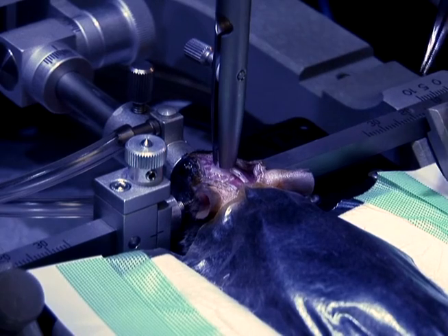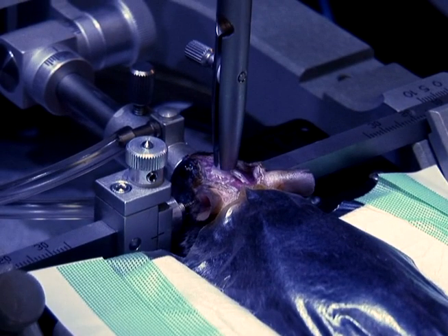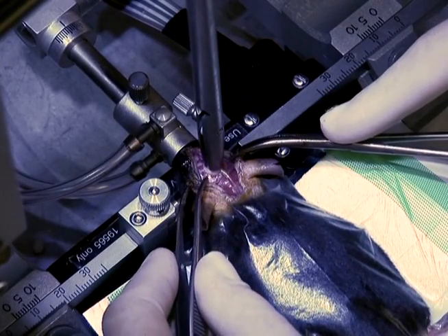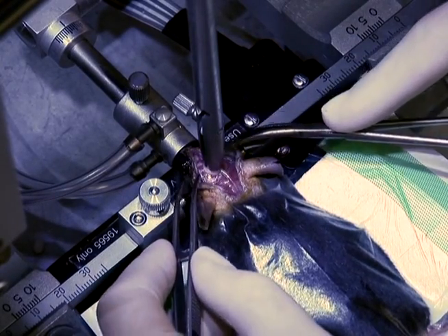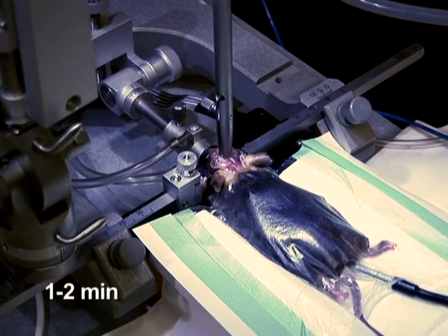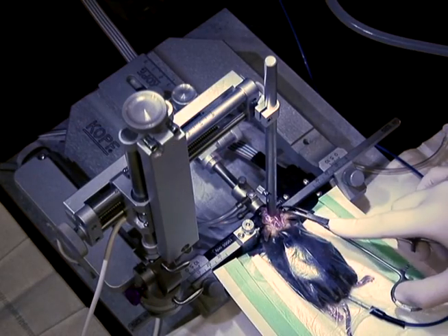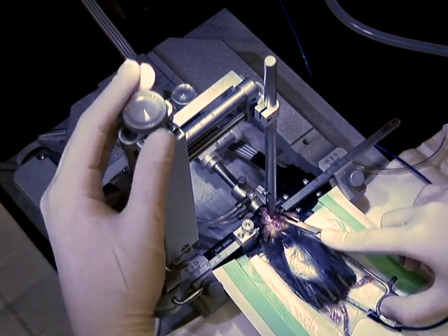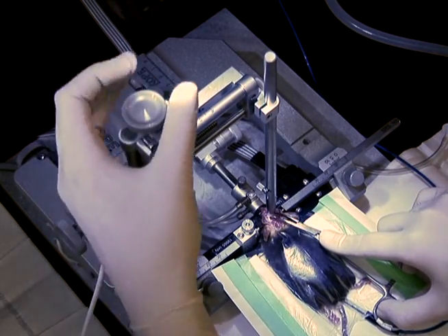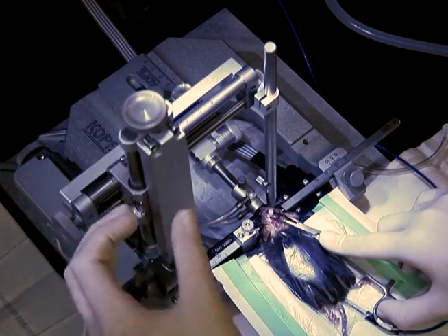Drive the catheter quickly through the skull until the cannula base is securely pressed against the skull. The catheter can be driven directly through the skull in mice due to the relatively thin skull. Pull any skin that has glue on it away from the skull. Then, with the cannula driver holding the cannula in place, wait 1-2 minutes for the glue to fully dry. Next, hold the cannula in place with the curved hemostat while raising the driver. Slowly release the hemostat to ensure that the cannula is properly secured to the skull.